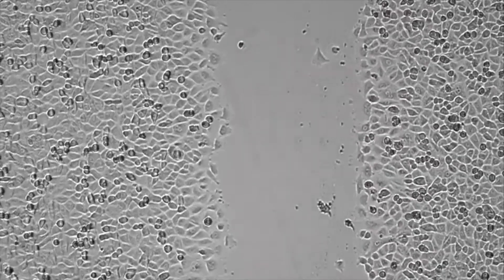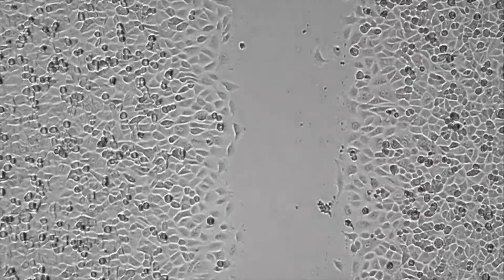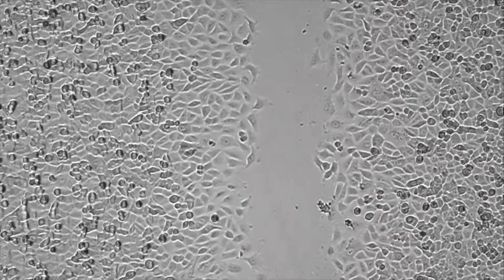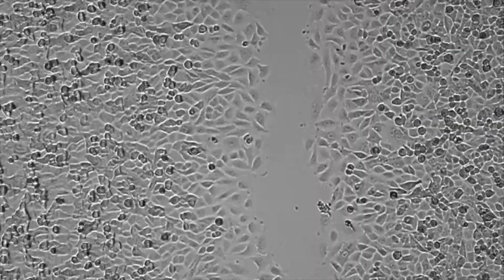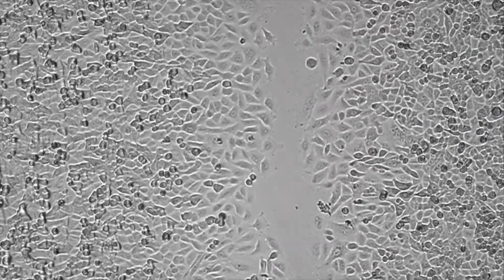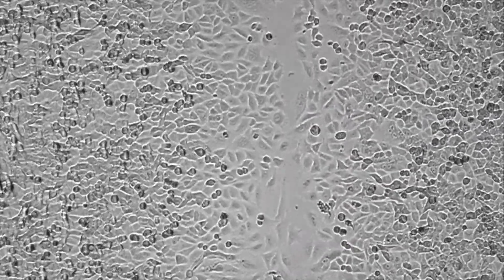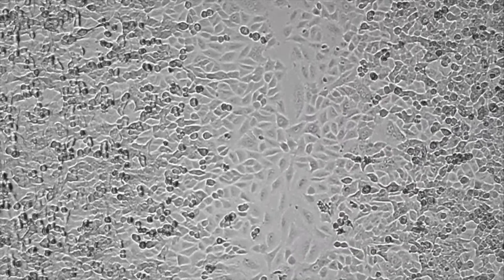The measurements acquired are normally taken by taking pictures of each wound at specific time points, but here you can see a very neat way to visualize the wound closure using live cell microscopy.